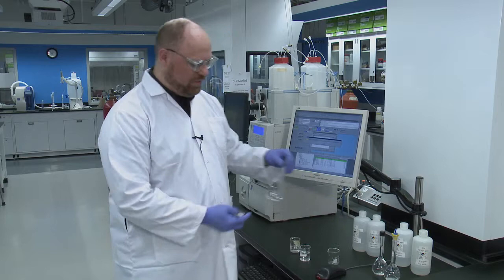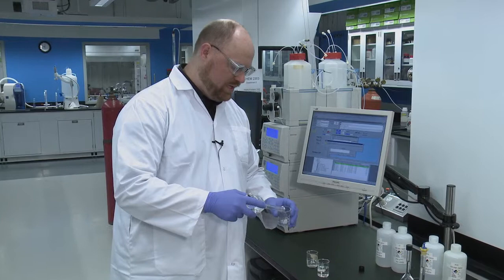So once you've done that, you're going to take the sample. The first thing that you're going to want to inject is the unknown. So we're going to transfer some of that to a beaker.